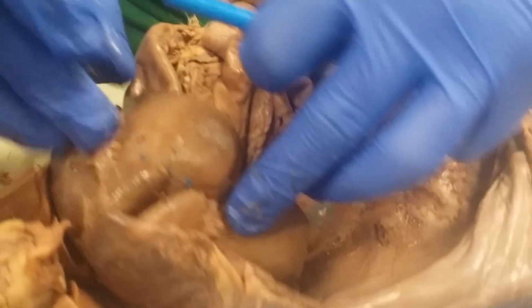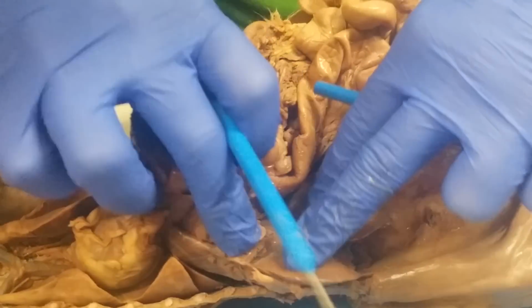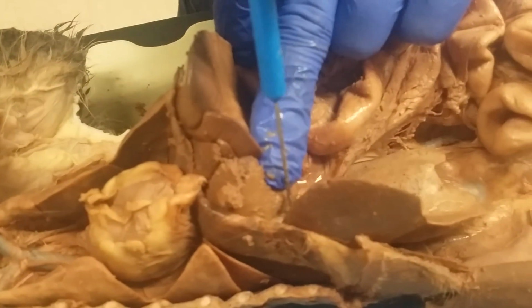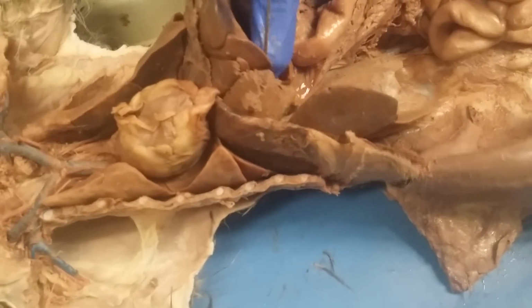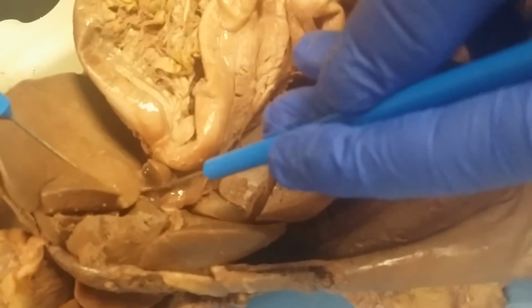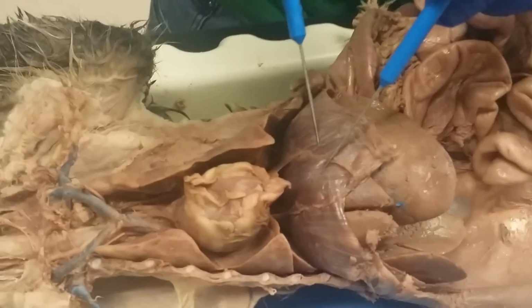So then you got the liver right here, which is just all these lobes and everything. On most of the cats, this right here is going to be the gallbladder. Most of the cats is going to be a lot greener in color. Then you got the cystic duct, which comes off it. Then the common bile duct right here. Then the hepatic duct is going to be this little guy right here that connects to make the common bile duct. Hepatic duct.